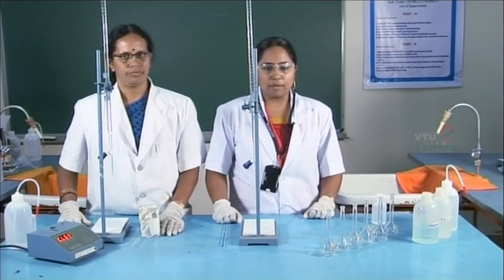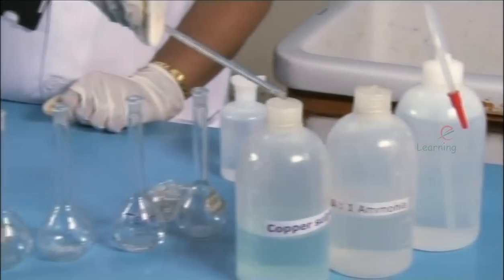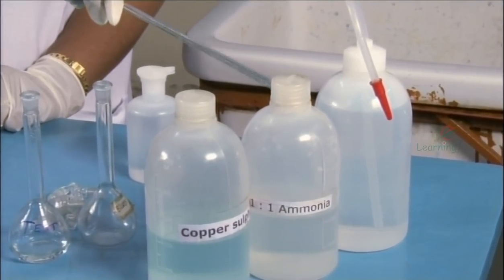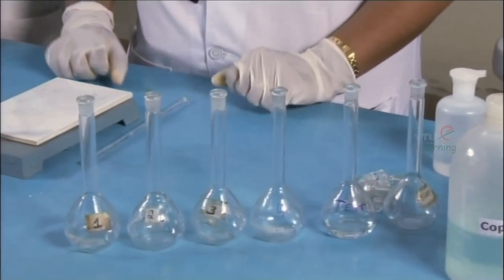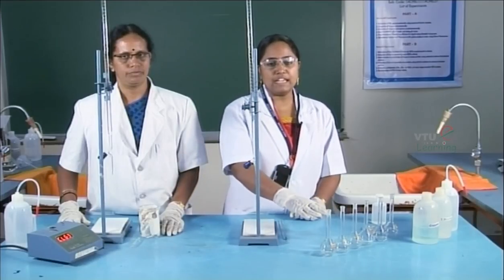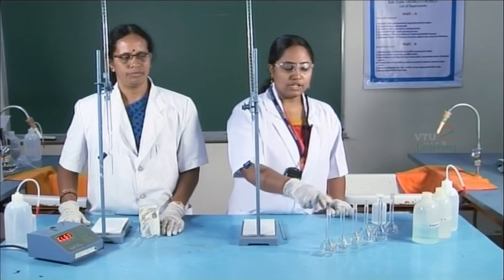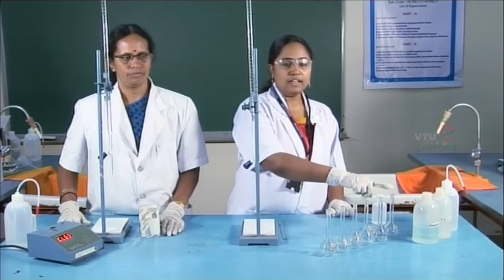The reagents required for this experiment are standard copper sulfate solution and 1:1 ammonia solution. For carrying out this experiment, we require six 50 ml standard flasks. They are labeled as 1, 2, 3, 4, test, and blank.